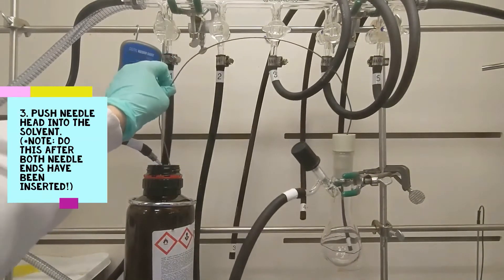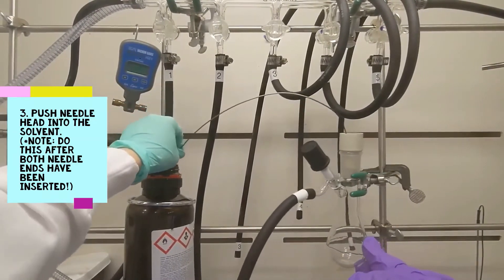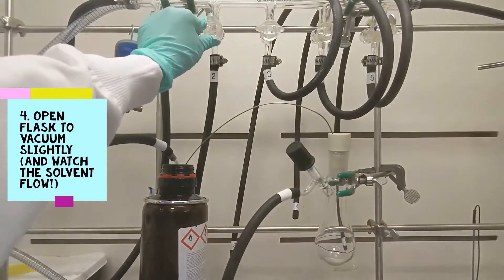Step three, once both sides of the needle are inserted to connect the solvent container and flask, now it is time to push the needle into the solvent liquid. Doing it this way minimizes contaminants from entering the system.